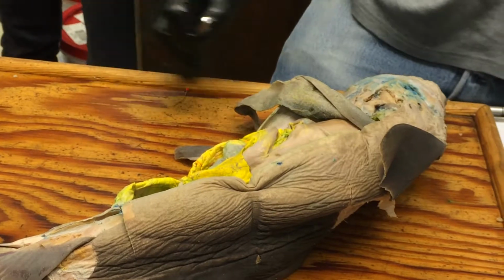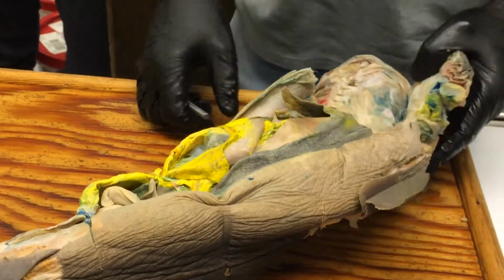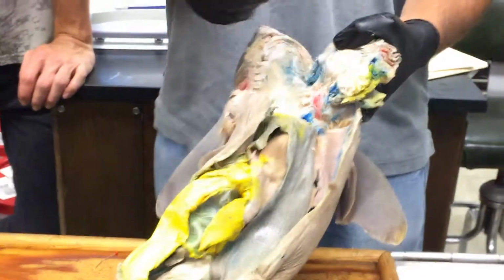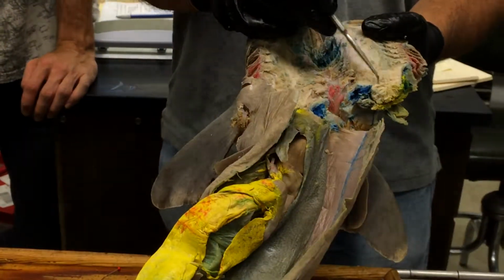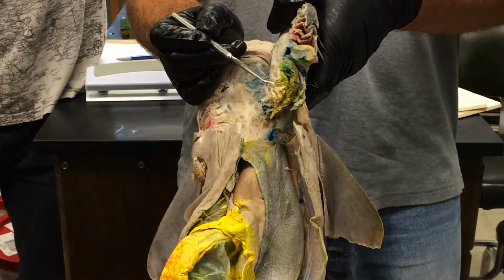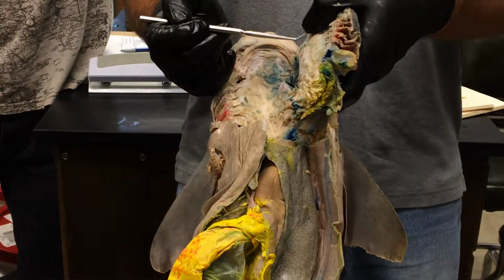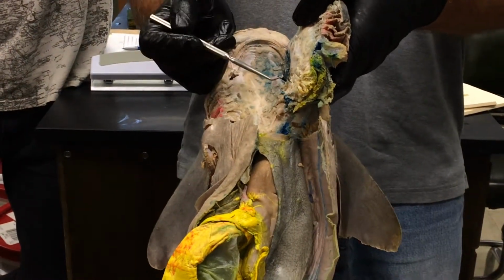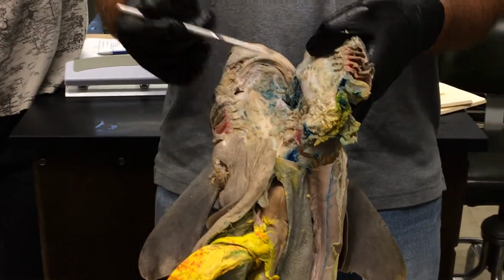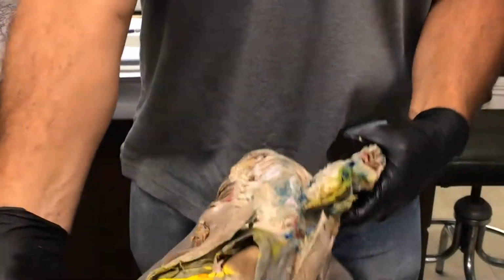Okay, further structure of digestive organs. So we get to esophagus, and it says papillae. Since you cut open your pharynx and gut, you can see all these little papillae that line the esophagus right here. That's the easiest way to distinguish esophagus from the pharynx and the stomach, the presence of those papillae on the inside. On the outside of the esophagus, there's really not a clear distinction from the stomach. Okay.